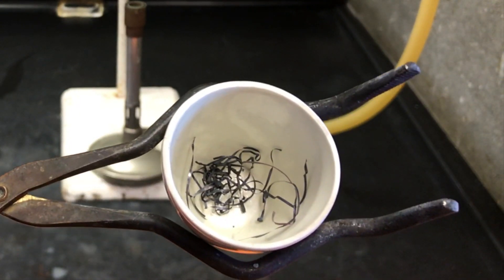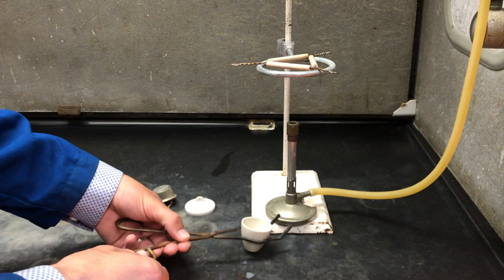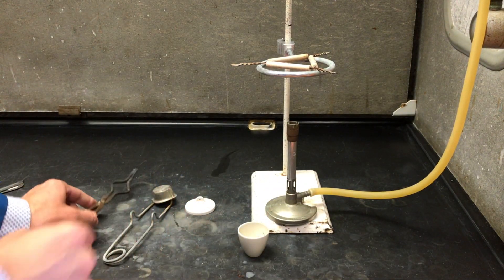Allow your equipment to cool to room temperature. Then dispose of the material in the labeled container and wash your crucible.